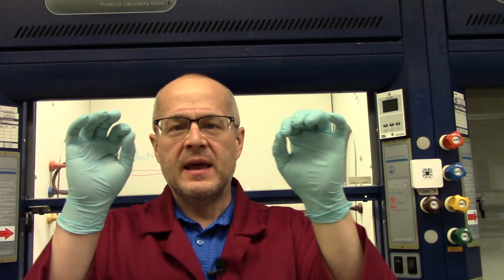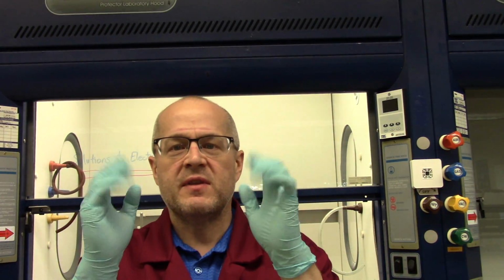A weak electrolyte, however, dissociates only slightly in water to give you some cation and some anion, but there's lots of that parent molecule still kicking around in the solution, dissolved up in the water. All right, guys? So we're going to do some experiments today with electricity. We're going to see which kind of solutions will conduct electricity and which ones won't. Strong electrolytes will, big hint. Weak electrolytes will too, but only slightly. And non-electrolytes will not conduct electricity at all.